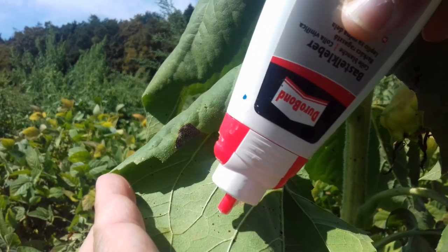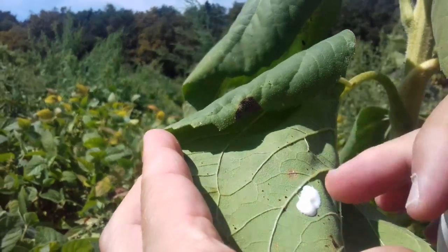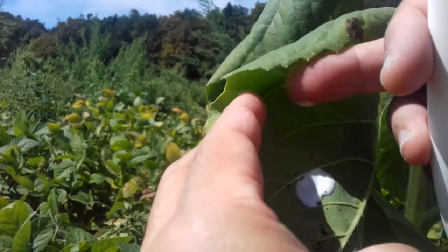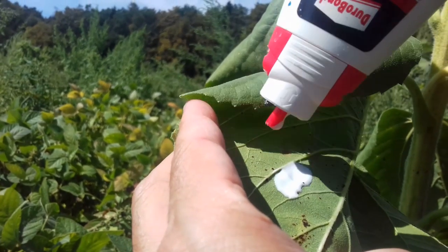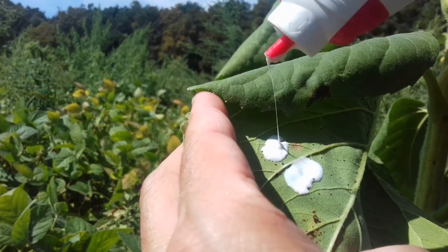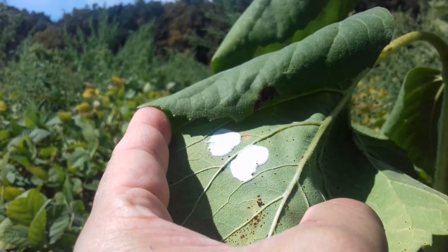Let's get started and apply a little bit of glue here. That's very thick, so I'm going to simply cover it. I'm using white wood glue, and I also tried this with other types of glue — this also works. But white wood glue has the advantage that it only uses water as a solvent and not some organic substance which might harm the leaf.